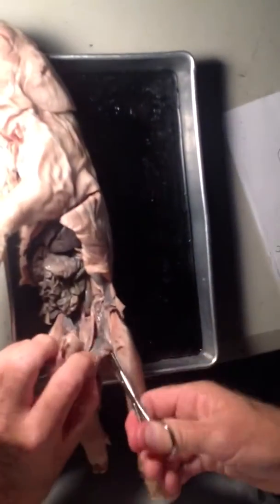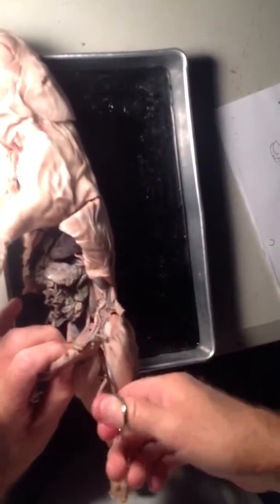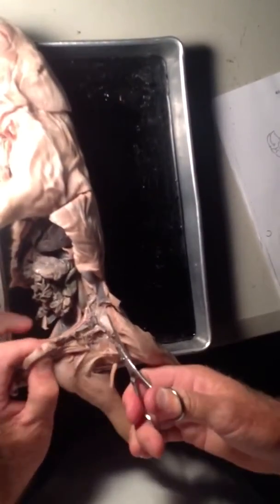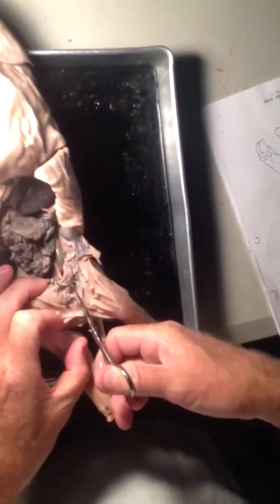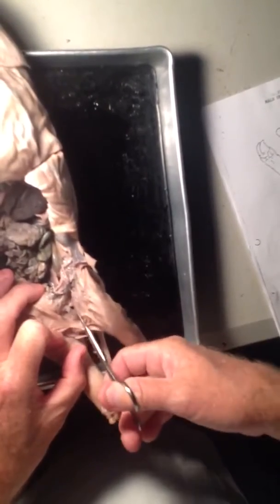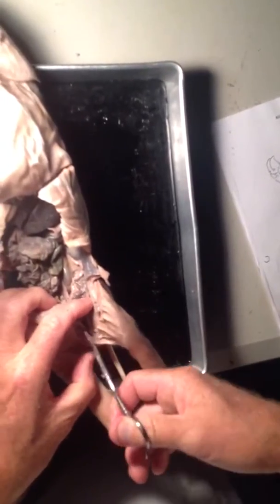What I need to do is get into the scrotum. To do that, I need to cut down right here. The group in here did a great job without knowing what they were doing — they thought they had a female, cut down, and ended up having a male. It's always good to know what sex your pig is. That little pop hole right there — that's what I'm looking for. That would be the inside of the scrotum.